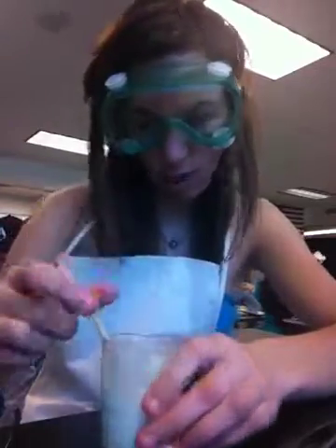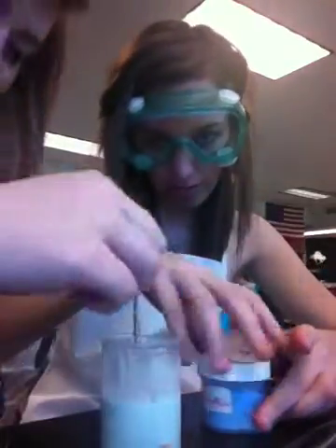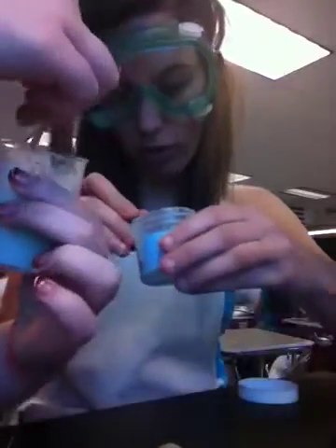Oh, dude, it's like bubbly. No, we need more. Yeah, we need more. No, I'm kidding. It's just bubbles because it probably is. Let's add some more copper sulfate. Is there any? Dude.